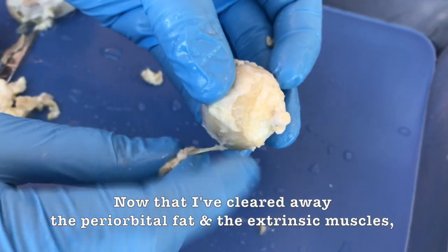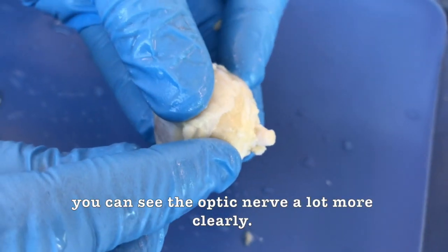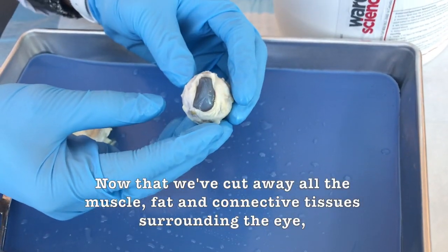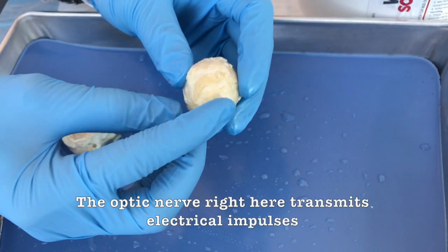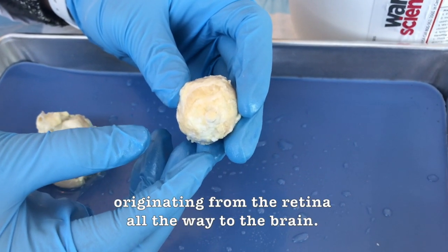Now that I've cleared away the periorbital fat and the extrinsic muscles, you can see the optic nerve a lot more clearly. Now that we've cut away all the muscle, fat, and connective tissue surrounding the eye, we can clearly observe the optic nerve on the posterior surface of the eye. And the optic nerve right here transmits electrical impulses originating from the retina all the way to the brain.